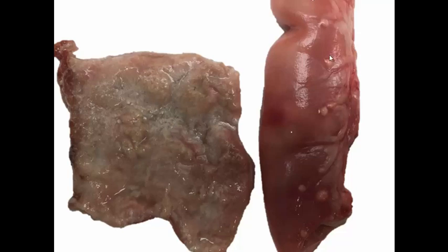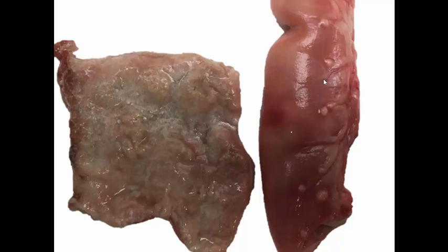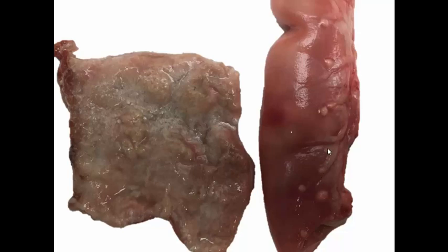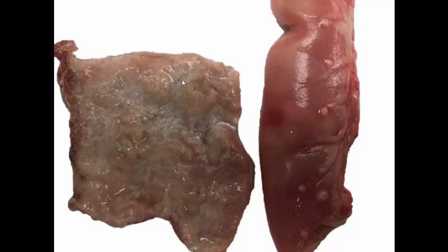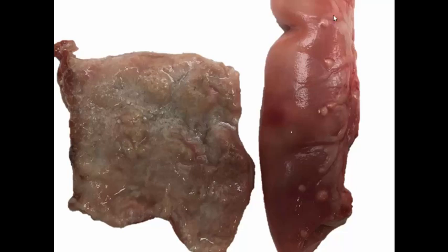On the other side of this piece of gut, along the lymphatics, we see lipogranulomas — these little granulomas — because there's always inflammation within the draining lymphatics. Lymphangiectasia can be a breed-specific disease, it can be the result of neoplasia, or it can result from some sort of obstruction of the lymphatic system, but it's most often breed-associated. The big deal with these animals is they are protein-losing; it's a major cause of protein-losing enteropathy in the dog. The morphologic diagnosis is a diffuse intestinal lacteal dilatation with granulomatous lymphangitis.